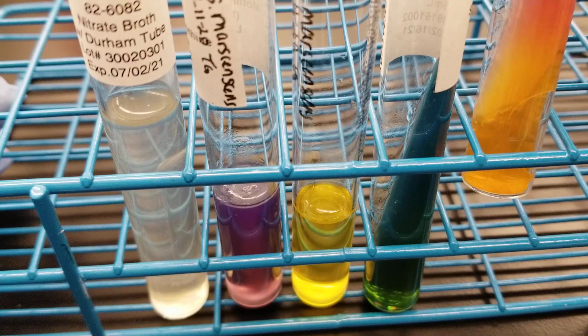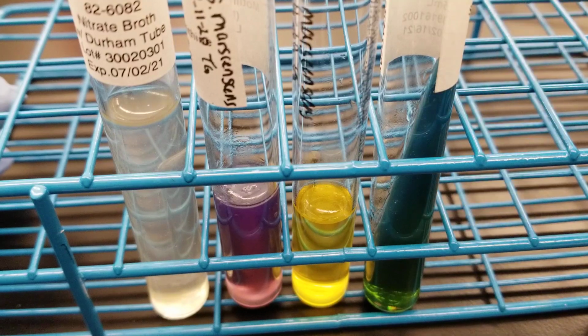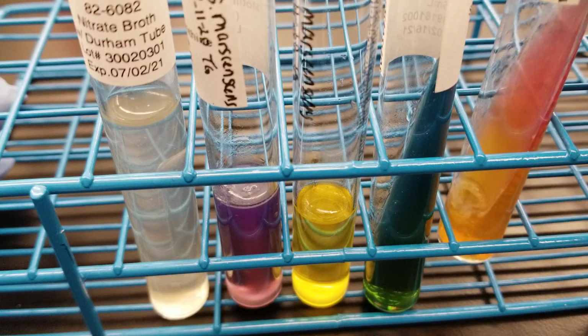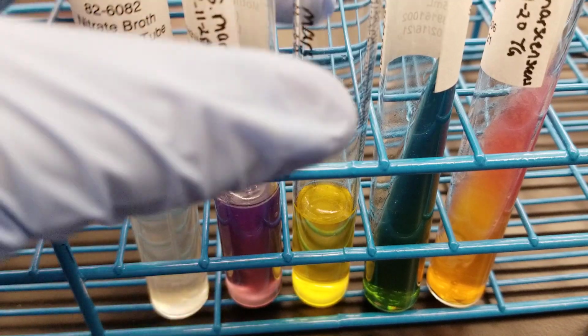There is a little bit of gas, and that's not very common. At least that's not what we're expecting to see, but there is a tiny bit of gas there. It's probably from me moving it around when I stabbed it. The media was moving around, so I might have introduced some gas myself and that not be from the organism.